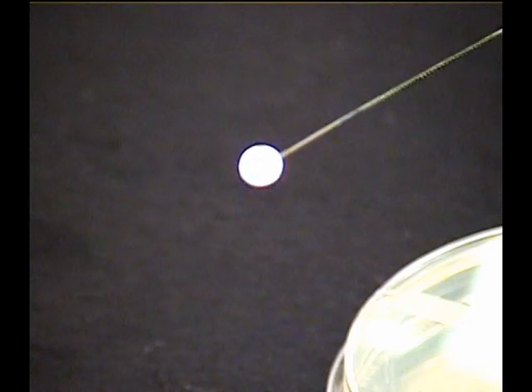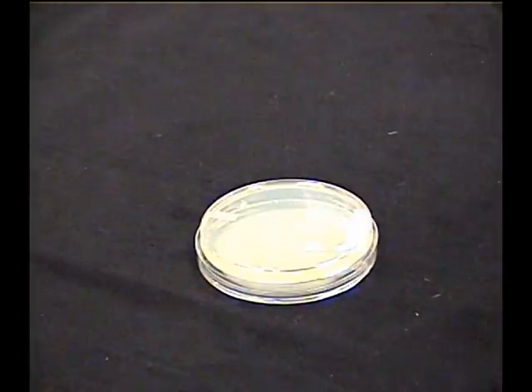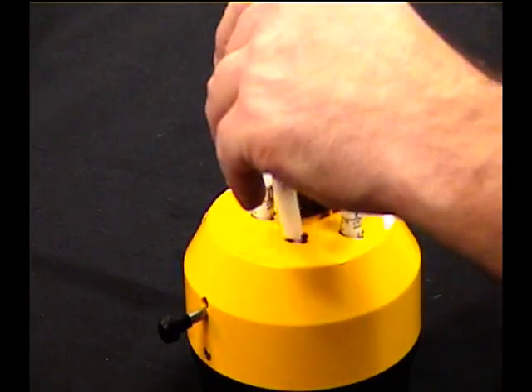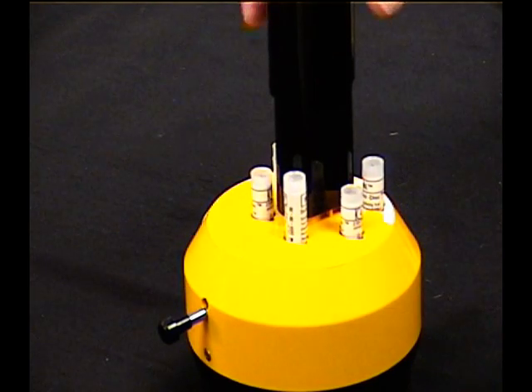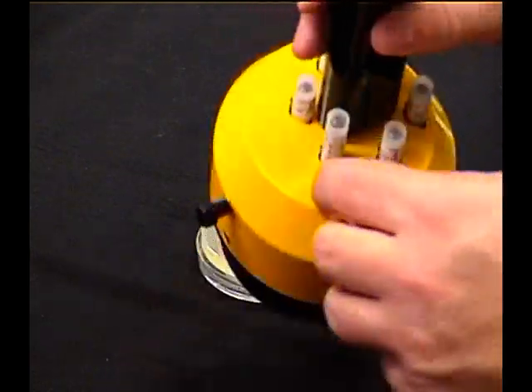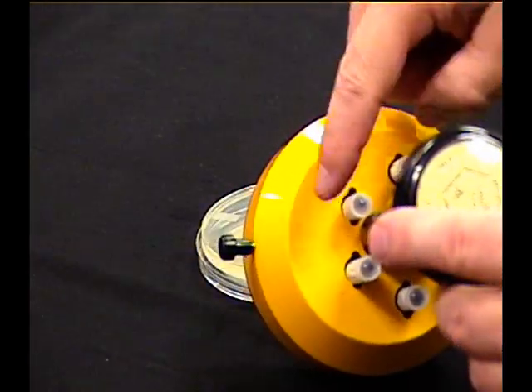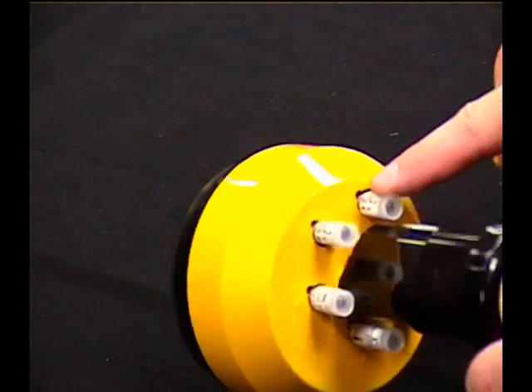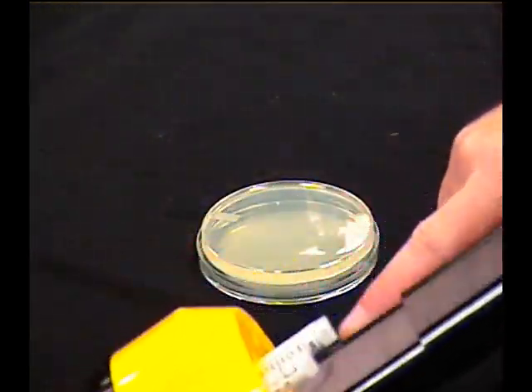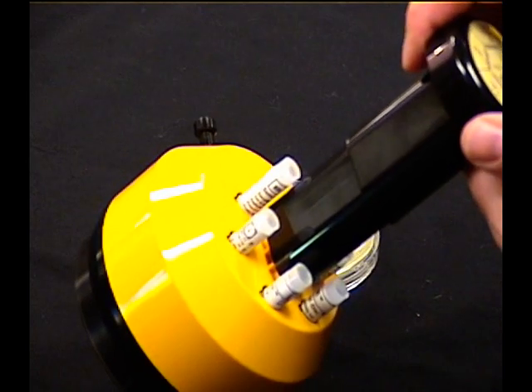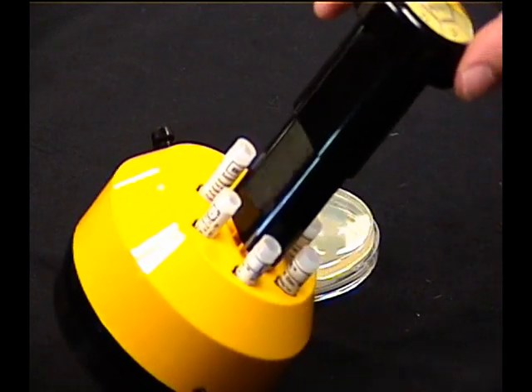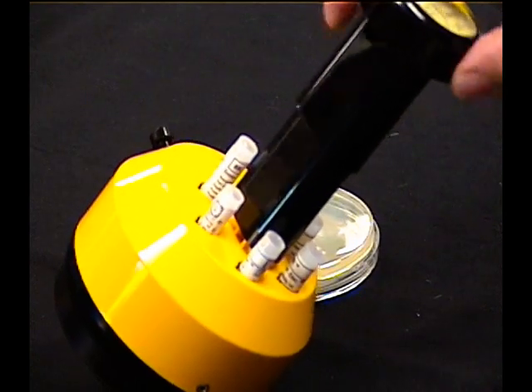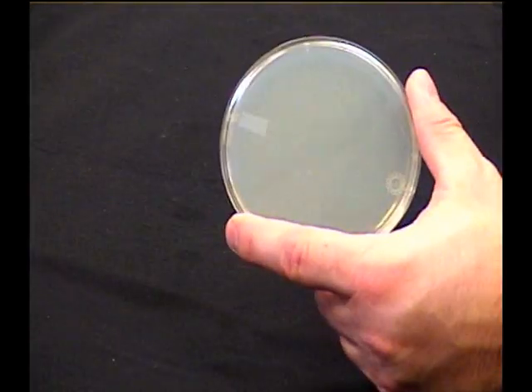We're going to put these onto the plates. They normally show up in a dispenser like this. The dispenser holds six, three on this side and three on this side. When pushed, this will dispense a set of filter paper discs onto our plate.